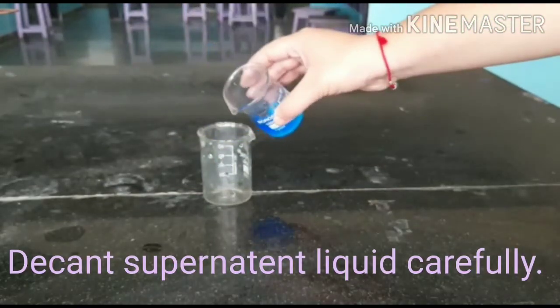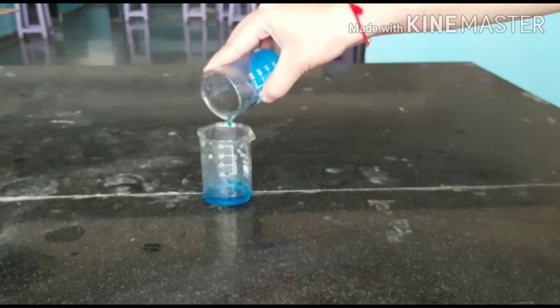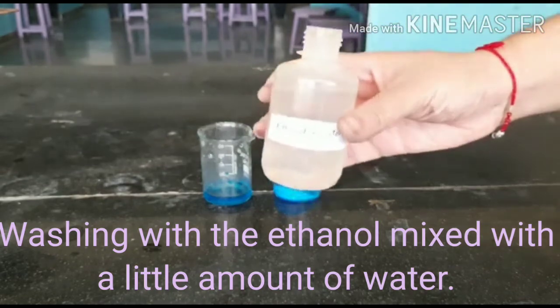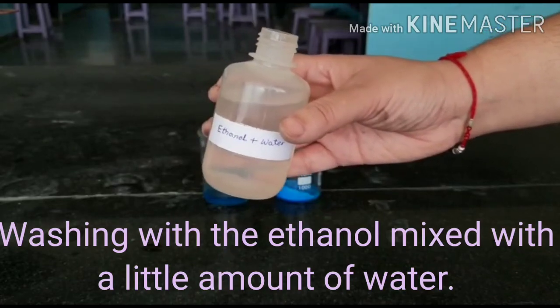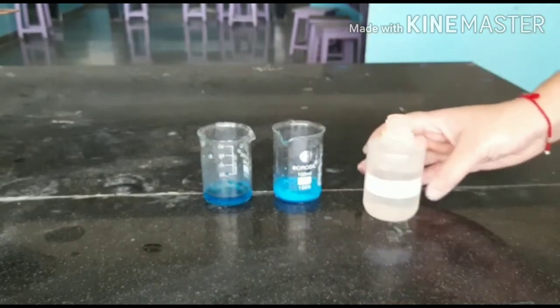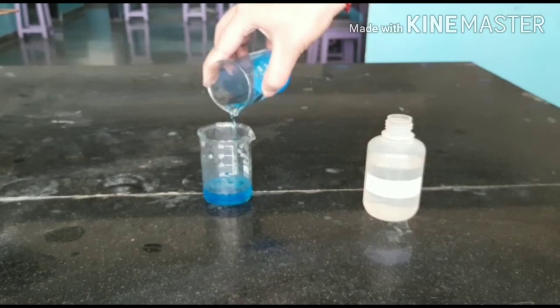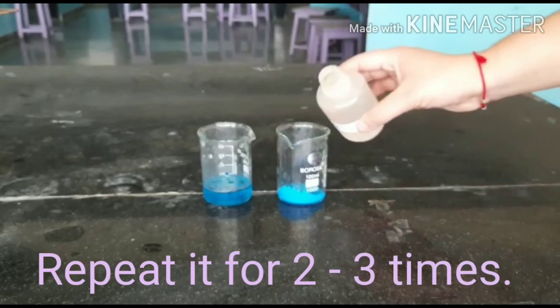We will decant the supernatant liquid. Now we will wash it with the ethanol and a small amount of water solution. We'll add a little amount, we'll shake it and decant the supernatant liquid. We will repeat it 2 to 3 times.